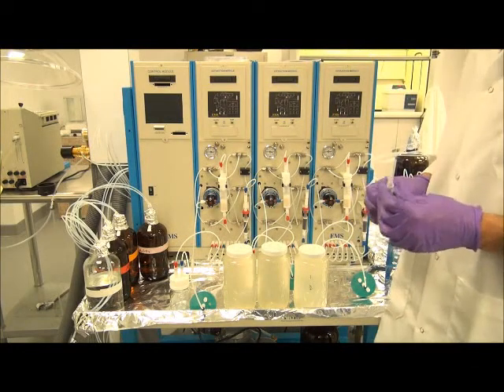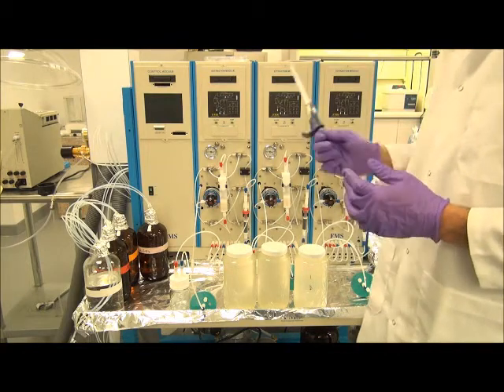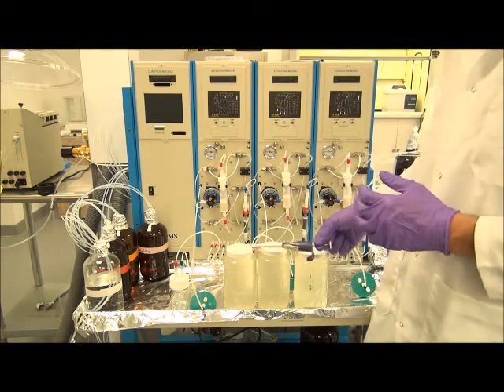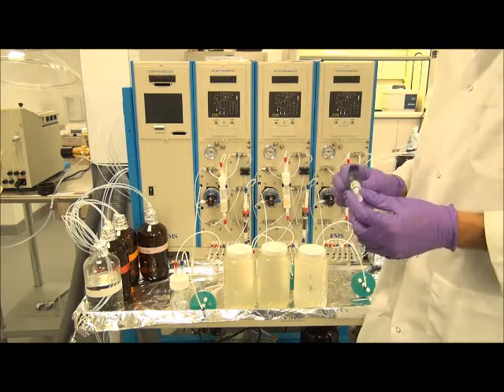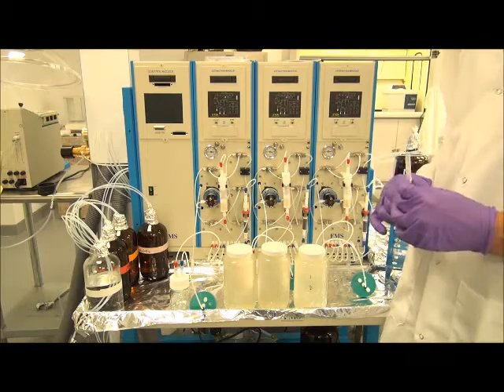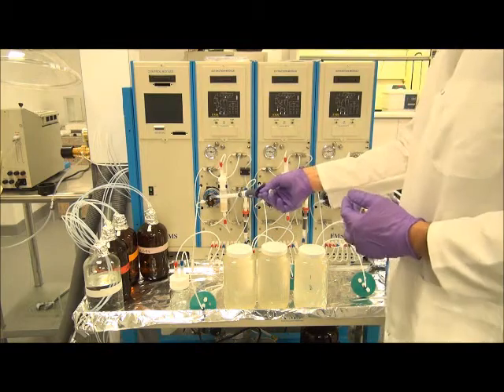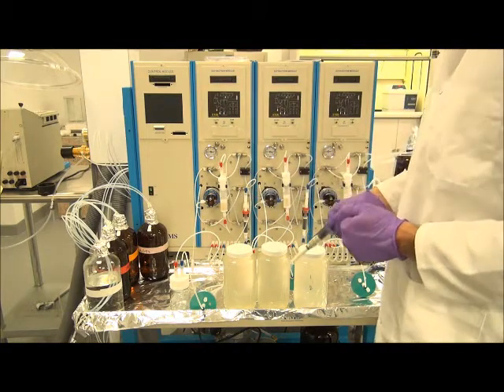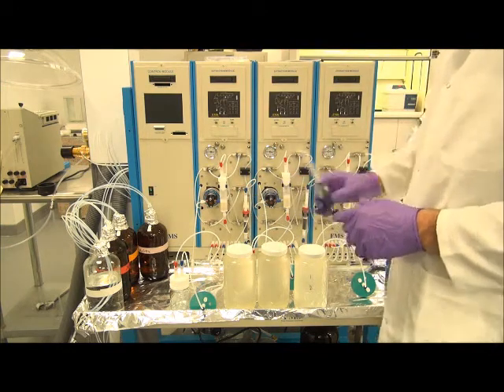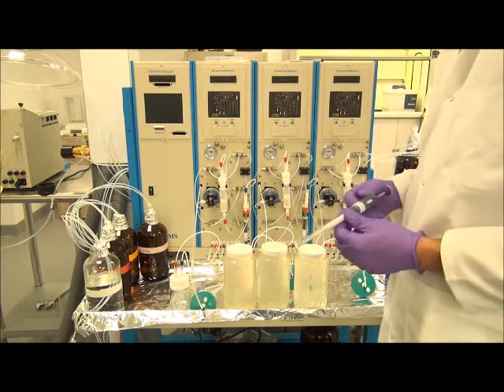What we'll be doing today is going over the extraction of 3 wastewater samples on the Fluid Management System's TurboTrace ABN system. There are 3 synthetic wastewater samples, 1 liter each, prepared for the extraction of EPA Method 625 for semi-volatile compounds. The system is a positive pressure solvent delivery, vacuum sample loading system in which water samples will be passed across 2 cartridges in parallel, and then each cartridge will be eluted separately into 2 separate fractions.